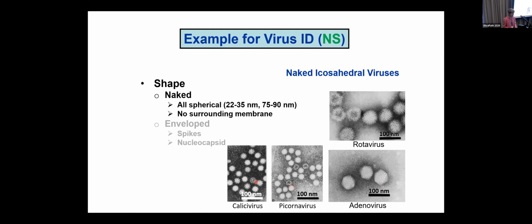On the left here, we have a small round virus that could be called a small round structured virus because some of the particles, depending on how they land, have structure on the outside that is recognizable. And you see that this has cup-shaped structures, and that's how it gets its name, calici, from the Greek word chalice.